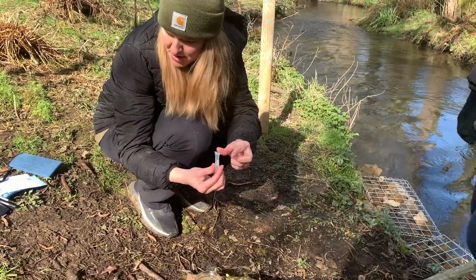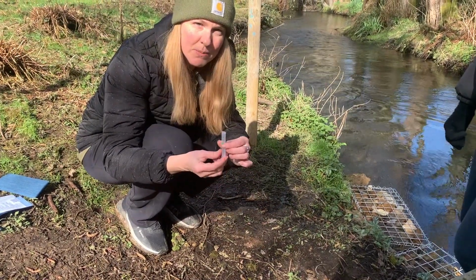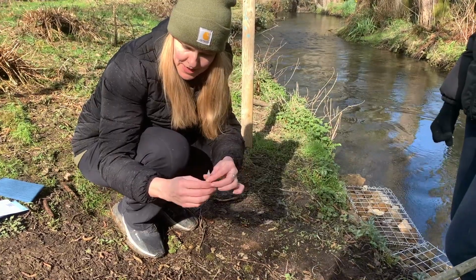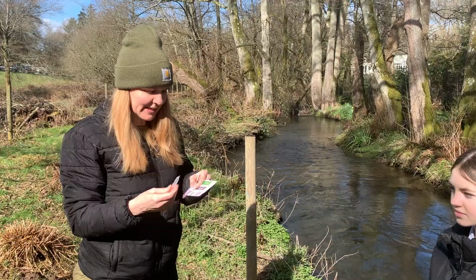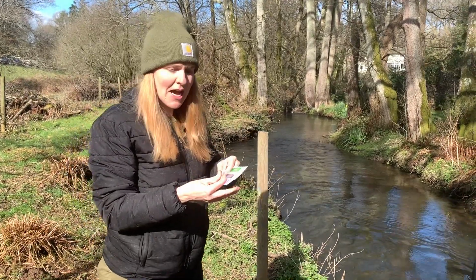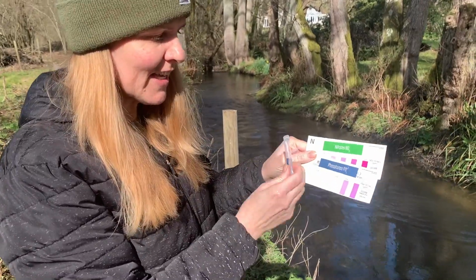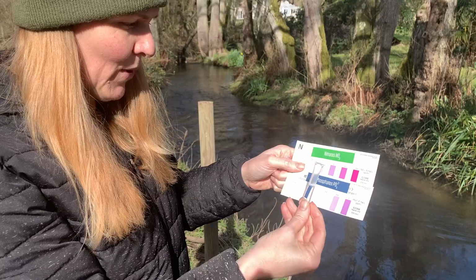We have given you enough for 2 of each type of nutrient test and 5 test strips. So you should be able to do your tests. Okay, now we'll set our timer for 3 minutes. All right, so our time is up. It is time to compare. Get your comparison charts out. Again, we've referenced the colors, the phosphorus and the nitrates with the blue and the green.